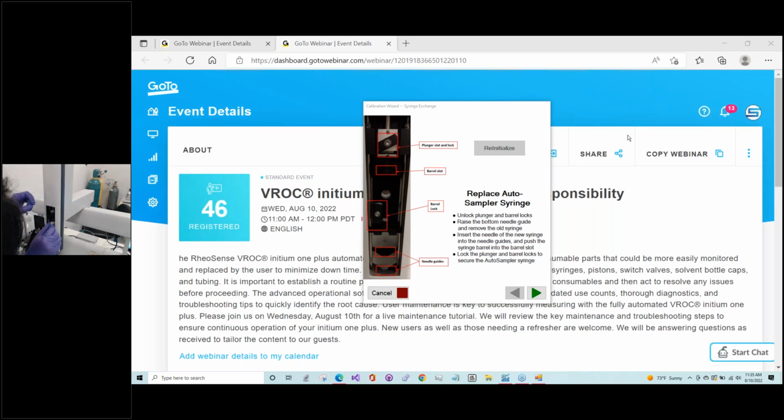There we go. And then I'm just double checking that the needle will go through the guard at the bottom. If you do move this guard, make sure you use two fingers. See if that's slid through. Perfect. And then to tighten this, you just put it slightly sideways. Then to get this piece out, to hold the barrel in place, you want to pull it out a little bit and then slide it to the side. There we are.